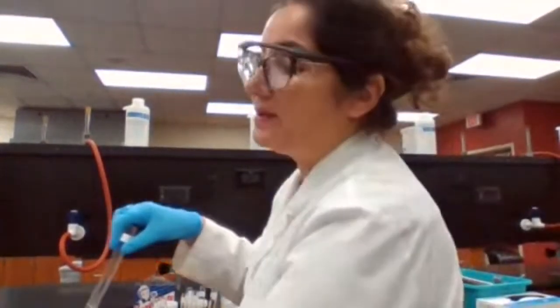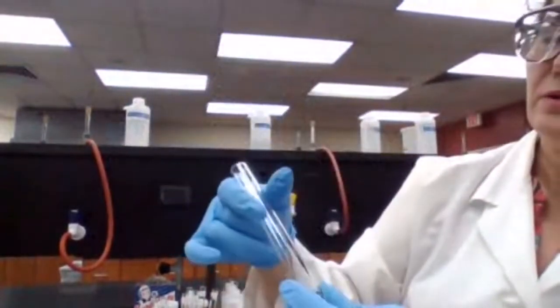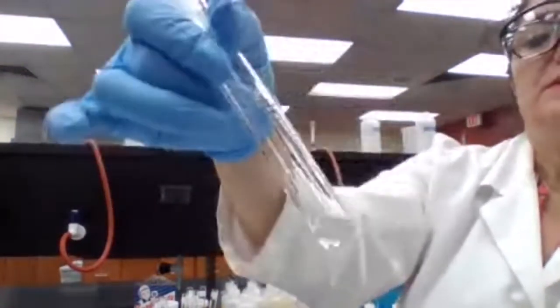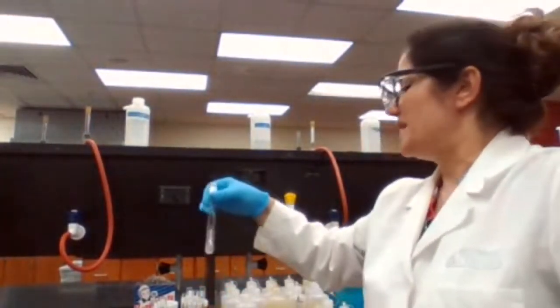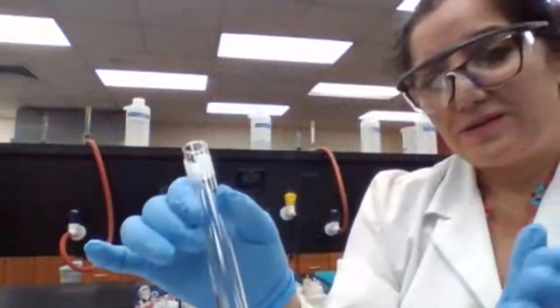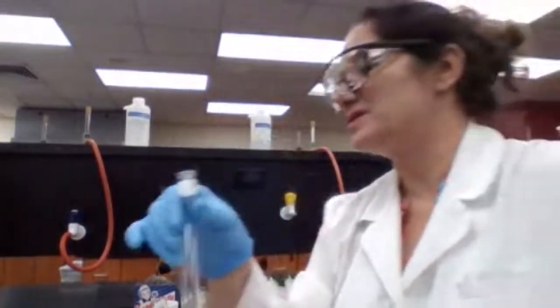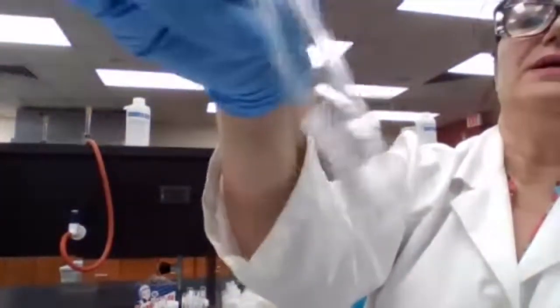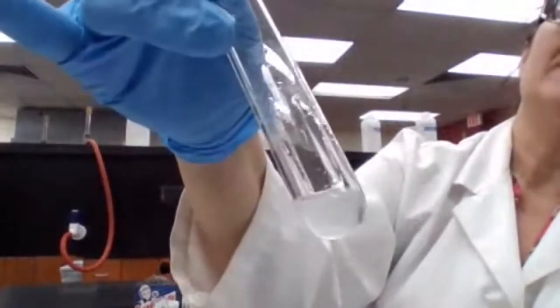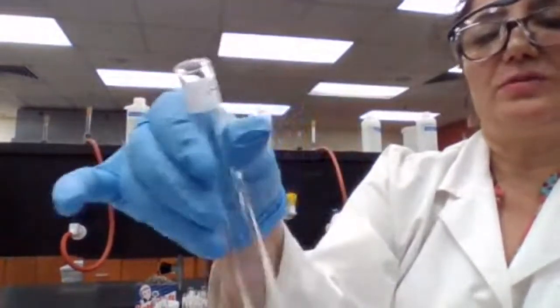For test tube E, we have zinc and magnesium chloride — I don't see any reaction, so no reaction. For test tube F, magnesium is added to zinc chloride. Since zinc didn't react with magnesium, magnesium must react with zinc when zinc is in solution as the metal ion. The metal ion is zinc and the metal is magnesium — there is a reaction. You can see the particles coming out and the magnesium going into solution. For test tube F, there is a reaction.